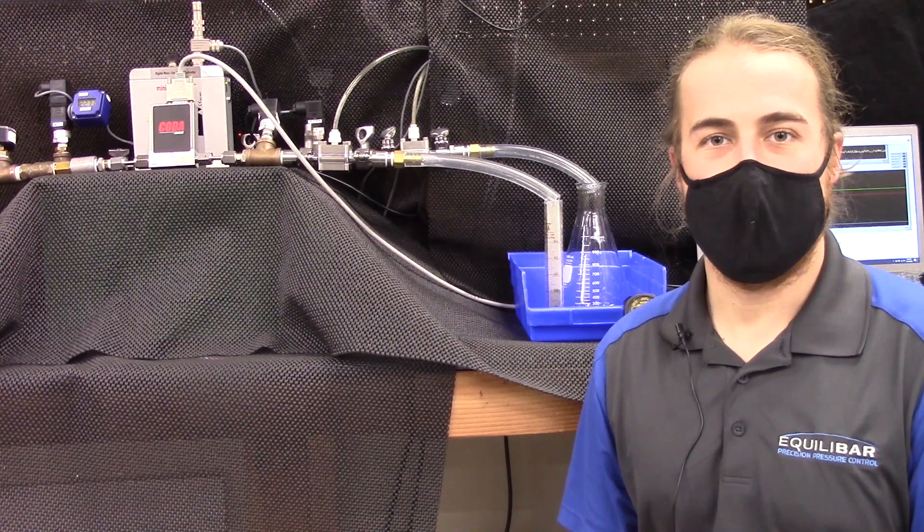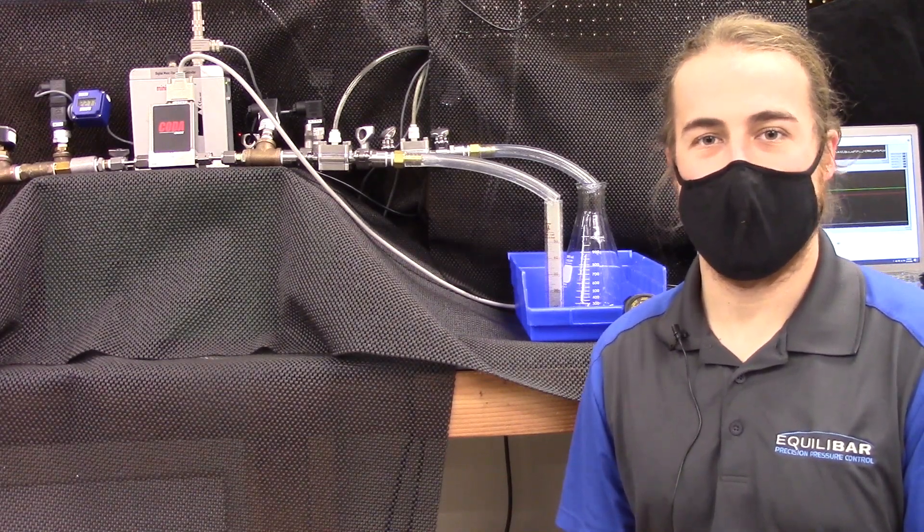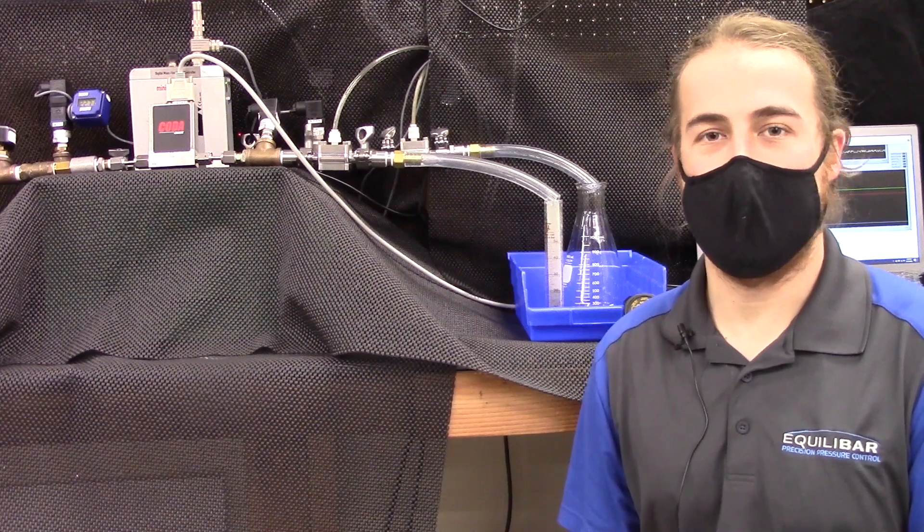Hello, I'm Carlisle Donovan with Equilibar and today I'm going to talk to you about how to use an Equilibar back pressure regulator as a flow control device in a simulated inline conditioning system.